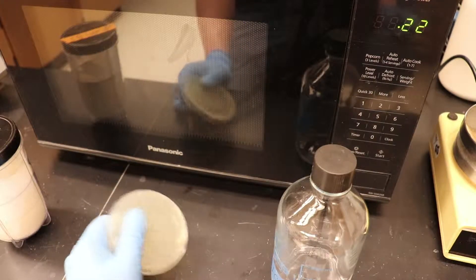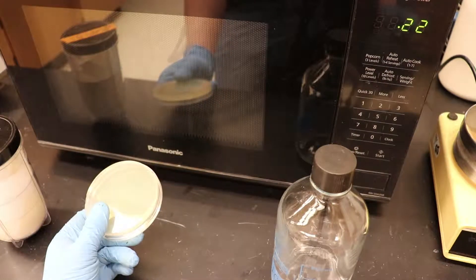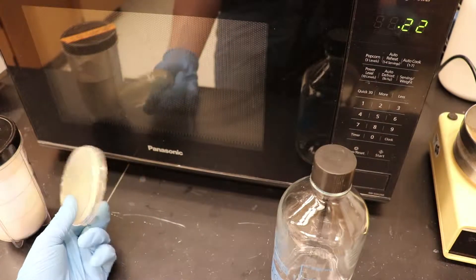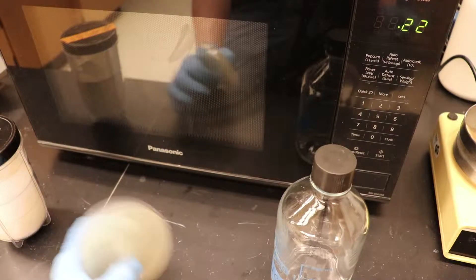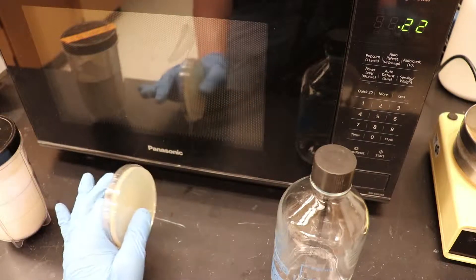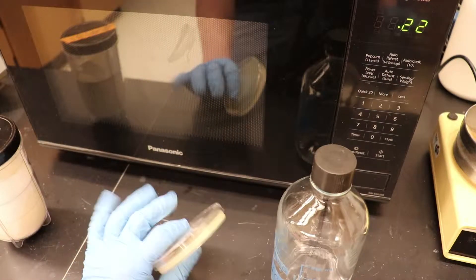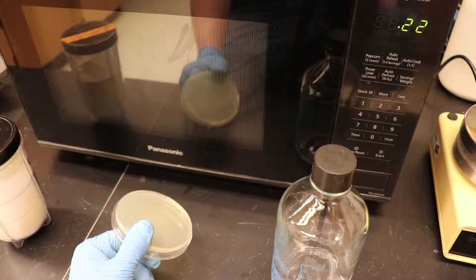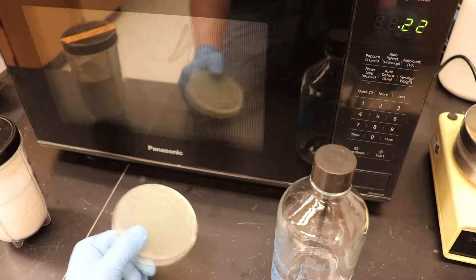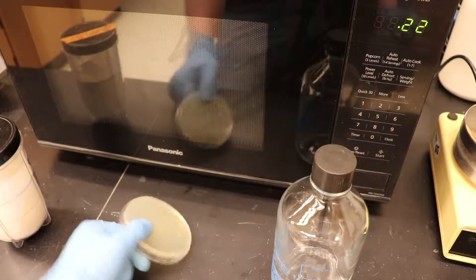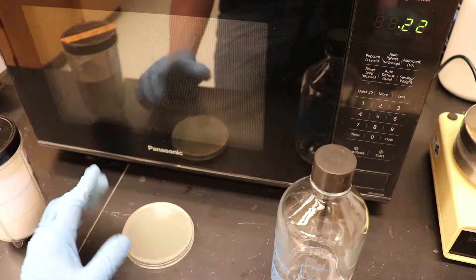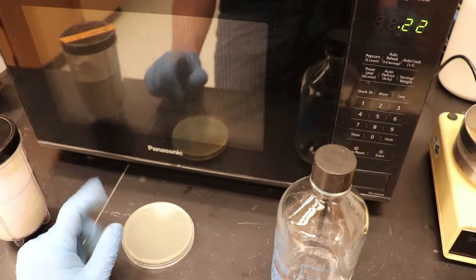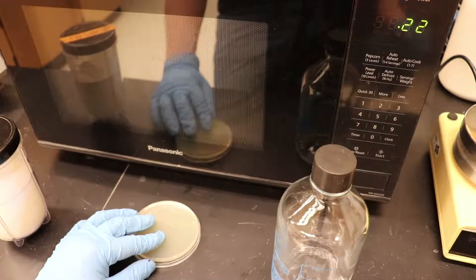You know, if your plates, if you let your plates sit around for months and months, maybe they'll start to grow at a slightly higher proportion than autoclaving, because microwaving, I don't think it will get rid of spores. But, as a quick and dirty solution, if you have half an hour, an hour, make some plates, you know, you just want to forge ahead, then this is the way to do it, okay? And I'll show you how. Just for the love of God, don't tell your thesis committee that I told you this, okay?